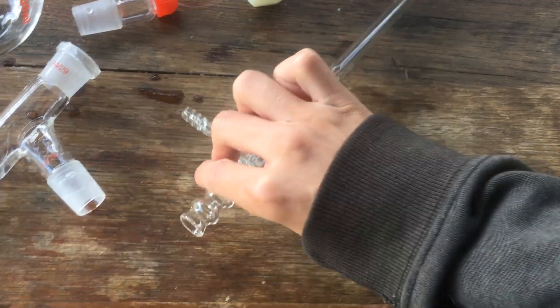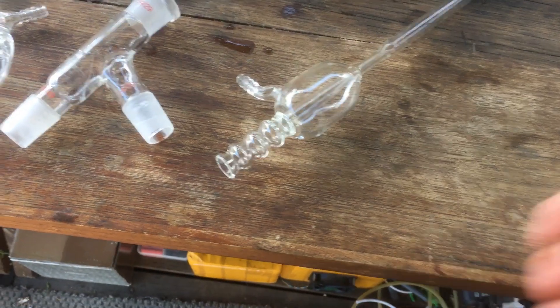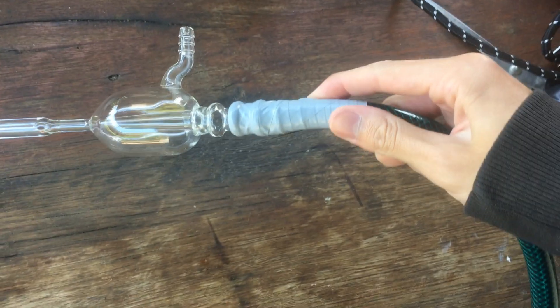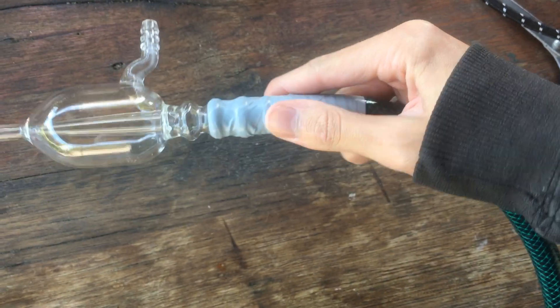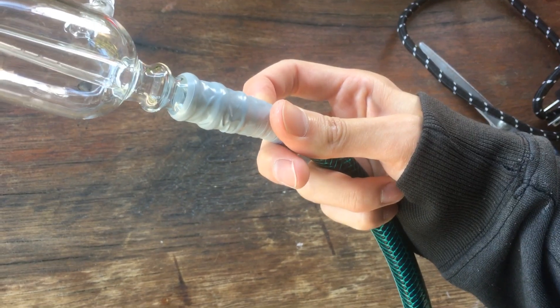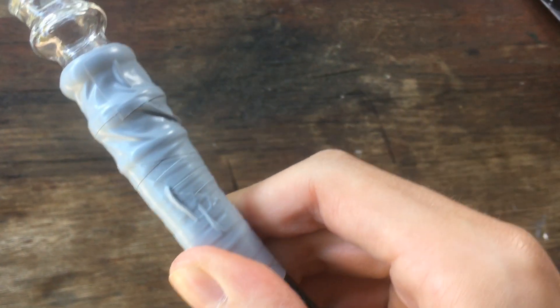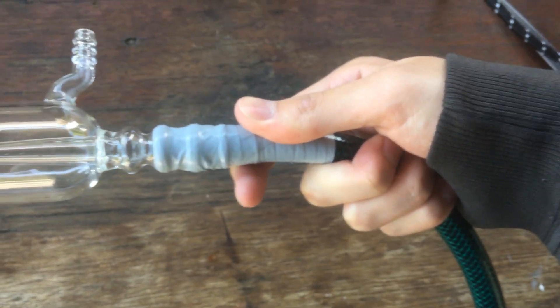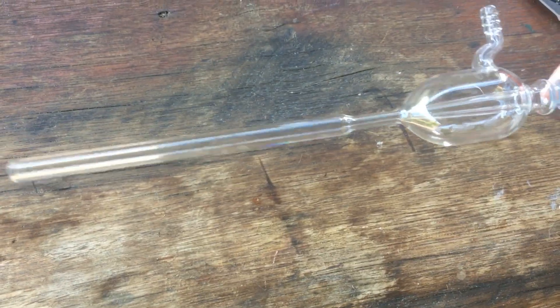This is a little bit of a weird thing to try to connect a hose to, but I'll do my best. I said it was going to be a tricky connection, and it definitely was, because I couldn't find any pieces of hose that would even remotely fit around this joint. So what I had to end up doing is taping it on, which really isn't the best, but it actually looks pretty alright. I think I've done a good job. So hopefully that stays sealed and we'll be able to run water through this hose and through the pump.